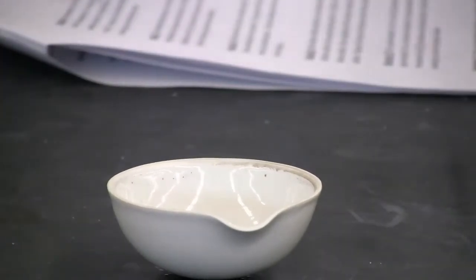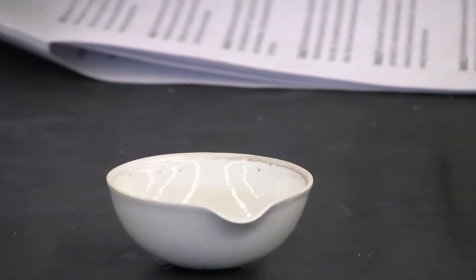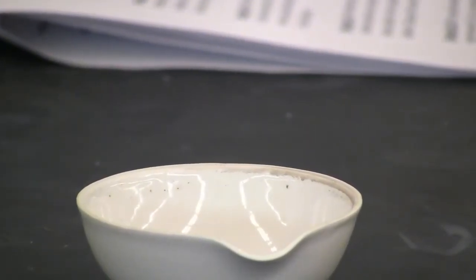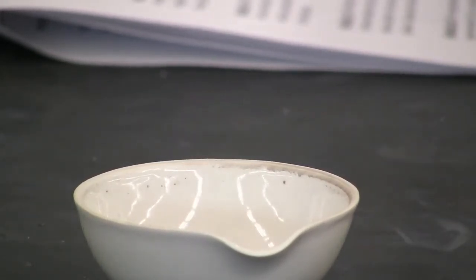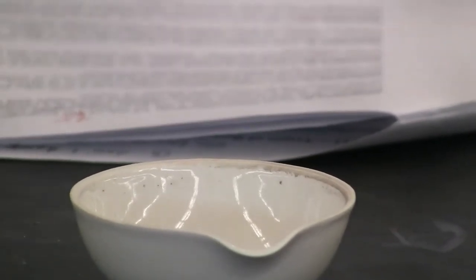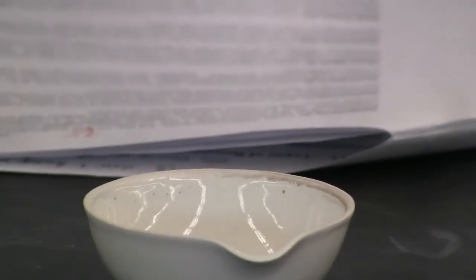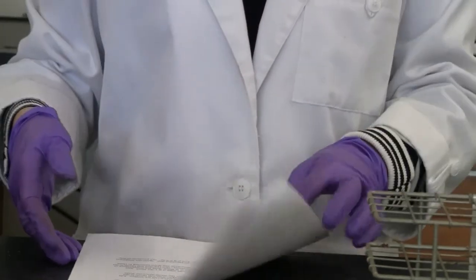And I can see from here sometimes a little bit of wind pushes the flame over against the bench, so it's a little blue, very, very light blue, almost transparent. And it's still burning, I can feel the heat. Okay, when all the methanol is burned completely out, sometimes you can see a little bit of yellowish color there. Okay, so it's almost done, and then nothing left in there. It's all burned out. Okay, so that's that reaction, and that's the end of the types of reaction 1.